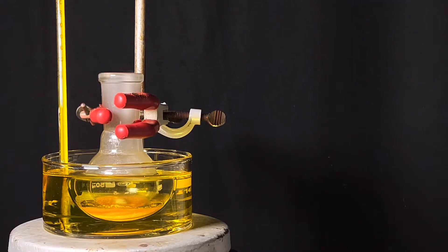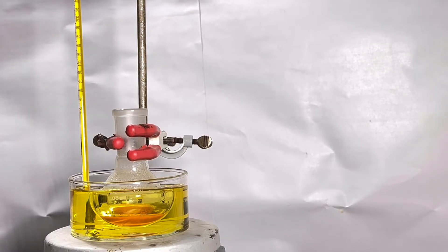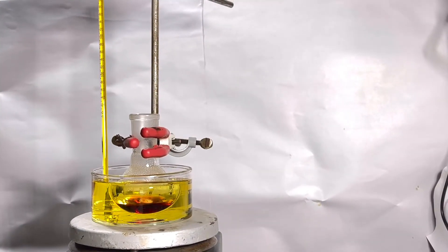Because the color change is not visually appealing with the black background in this case, I quickly swapped it with a white background. Now you can easily appreciate the changes in color of the reaction mixture from white to deep red.